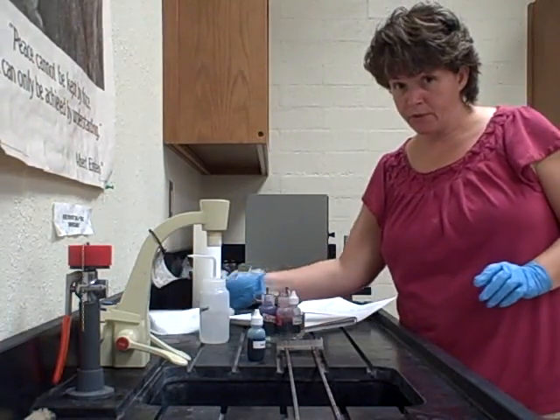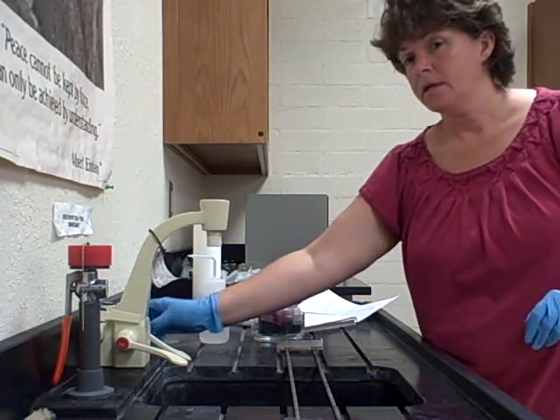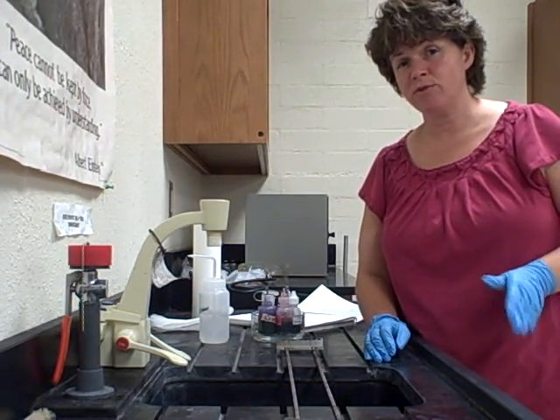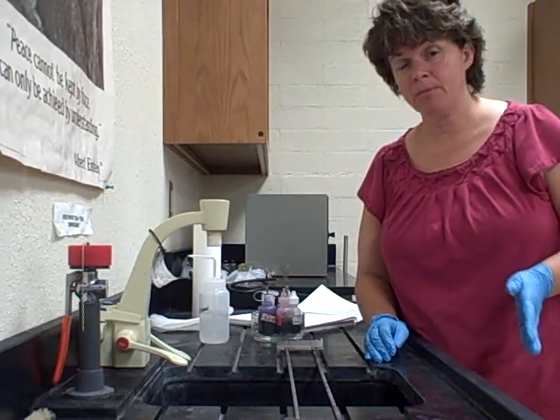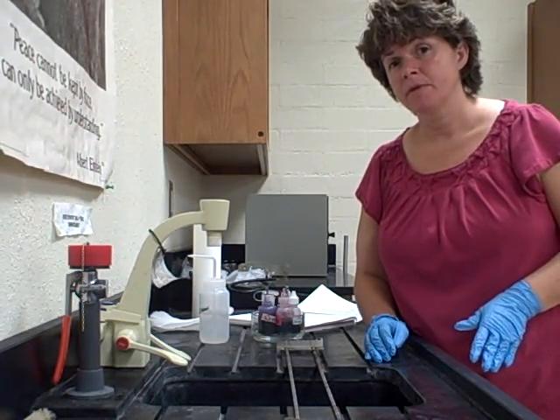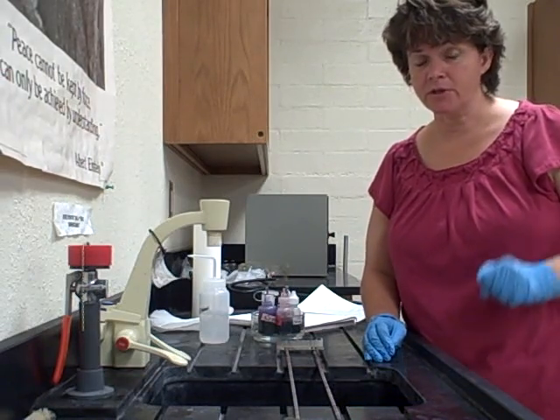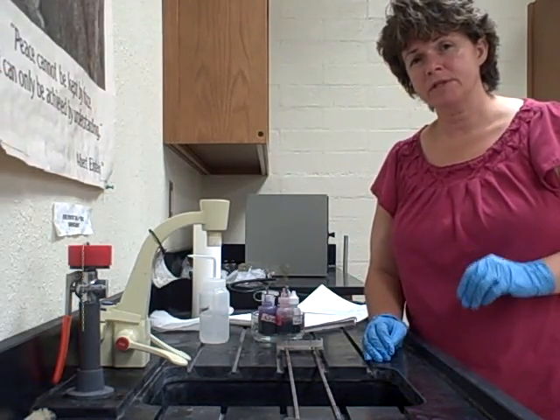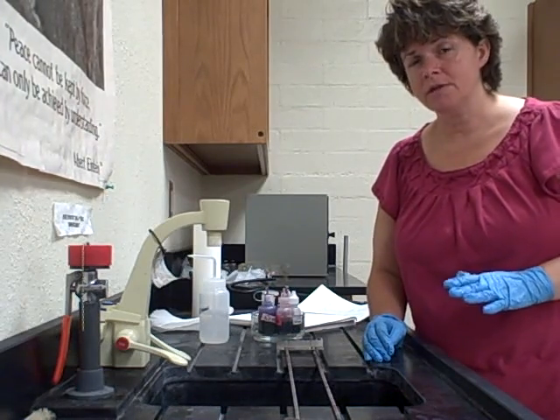We're going to do the gram stain. The gram stain is a differential stain because it's going to differentiate between different types of bacteria — gram positive and gram negative. You've learned about this in lecture or in your online lecture, and this is the procedure that we're going to use.